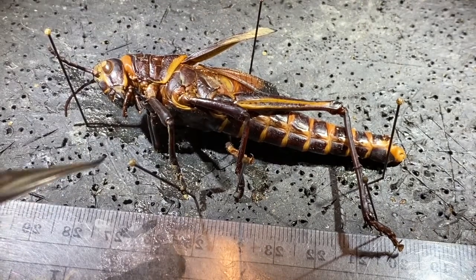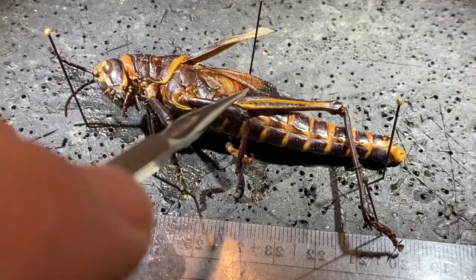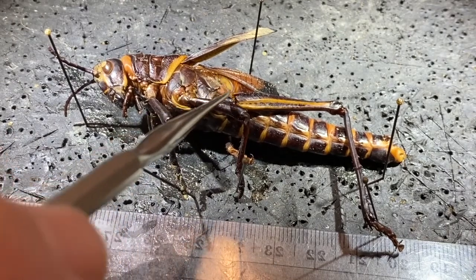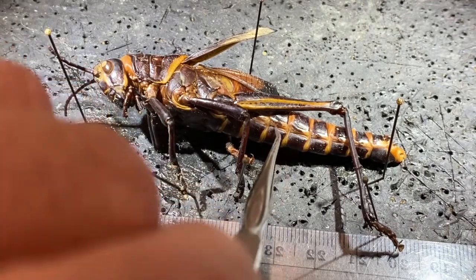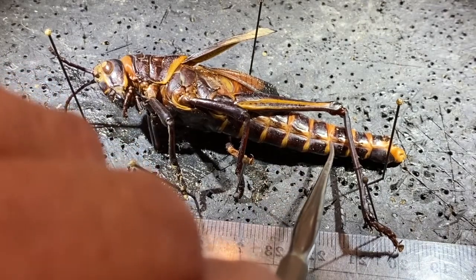If we come back up here onto the posterior part of the thorax, when these wings are not moved out of the way, this structure is covered, but this oval structure right here is the tympanum. The tympanum is the insect's hearing organ. This is a thin membrane. When vibrations come in, the tympanum membrane vibrates. There is an air-filled sac underneath, and then sensory cells inside that allow them to sense those vibrations.